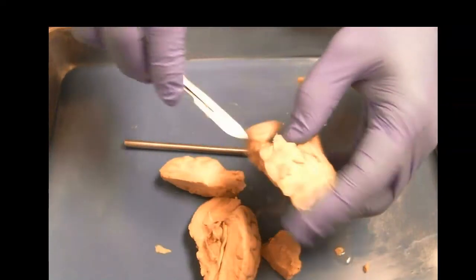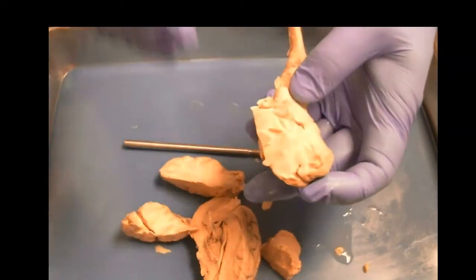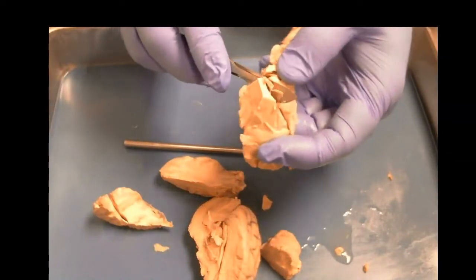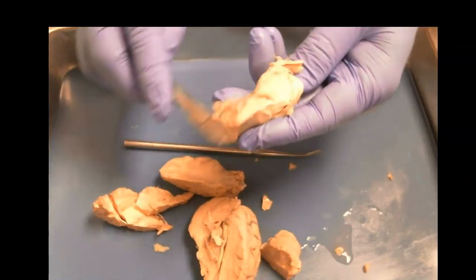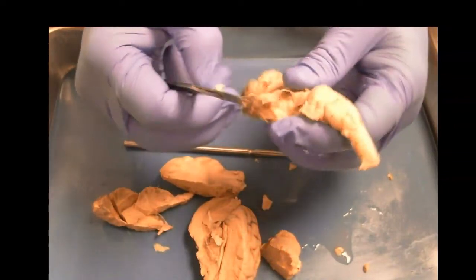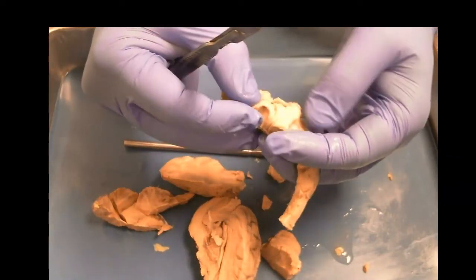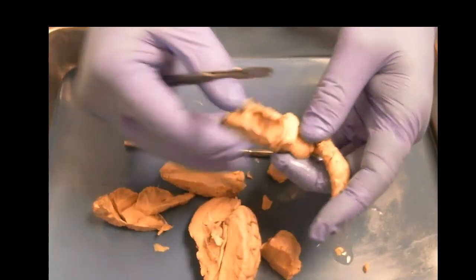They're really hard to find because the most common images we look at of the brain are basically the outside surface and the sagittal cut. So it's difficult to see there, and depending on how good you are spatially, it can be tough. So we can see it kind of here. Here we go. So we pull this off. We can see the tissue wrapping around in here. And here it is, wrapping around into the temporal lobe, and then the amygdala would be in here.